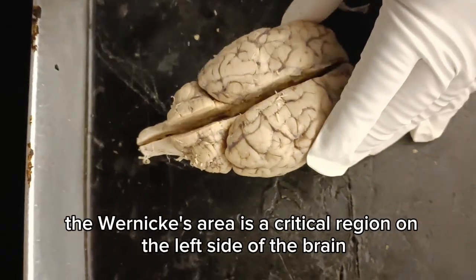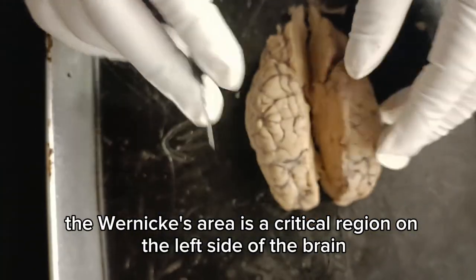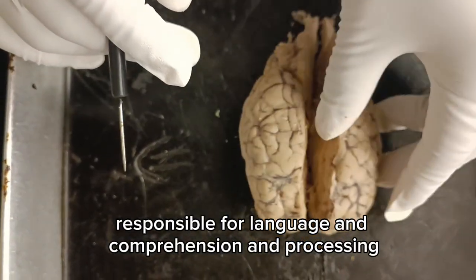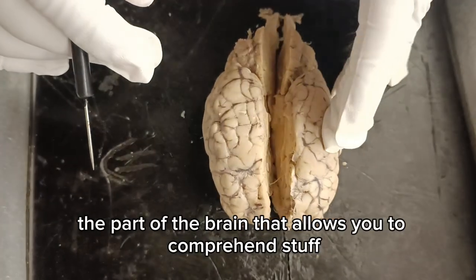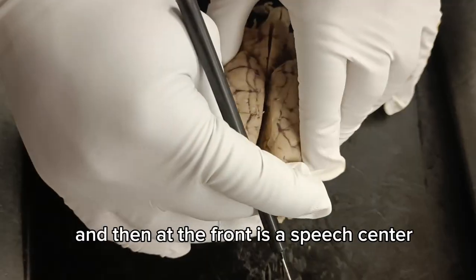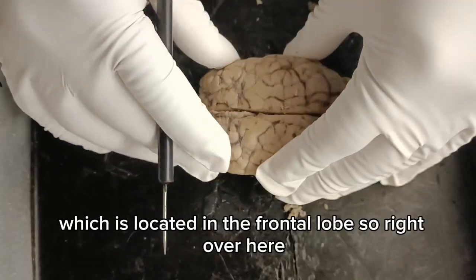Wernicke's area is a critical region on the left side of the brain, responsible for language comprehension and processing. This is basically the part of the brain that allows you to comprehend stuff, read, and process information. And then at the front is the speech center, which is located in the frontal lobe, so right over here.